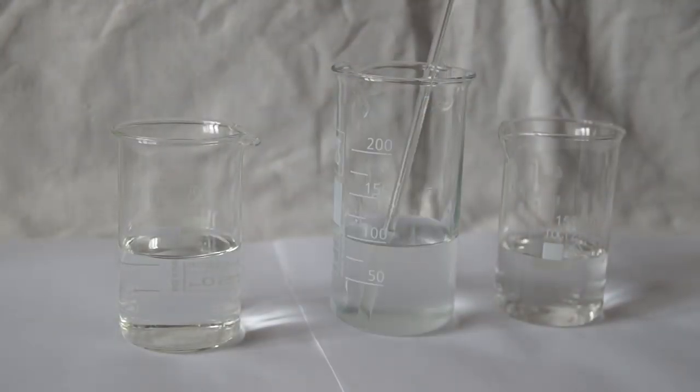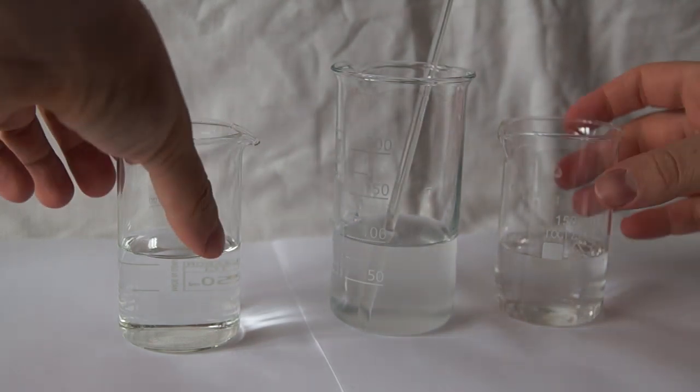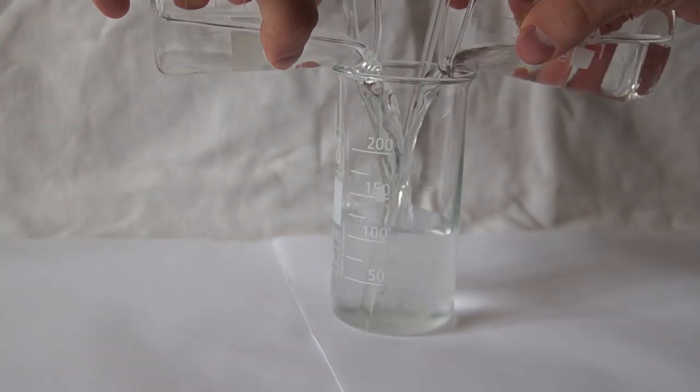Let's do the reaction again but just making it slightly more interesting. I am draining the solution into one glass.